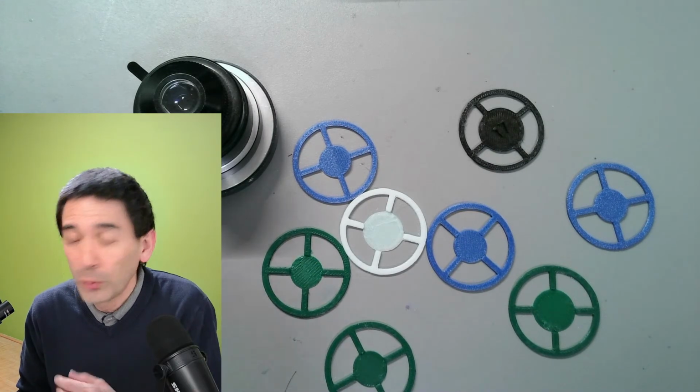So it's not a new technique, and I have already made a couple of videos before, but I also keep on experimenting around, and I basically just want to reintroduce this topic a little bit to you. Now, what is oblique illumination? Well, let me do it like this.